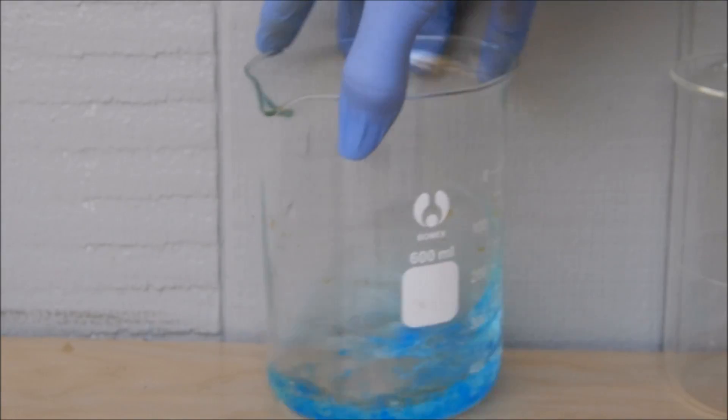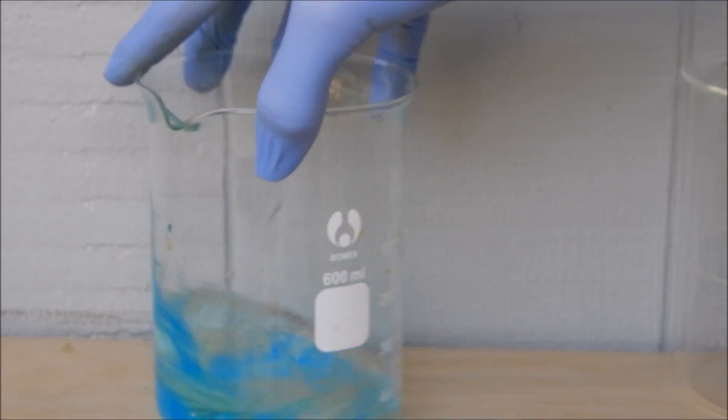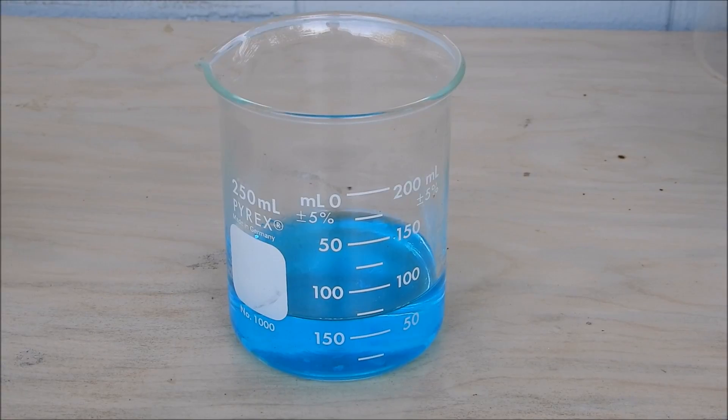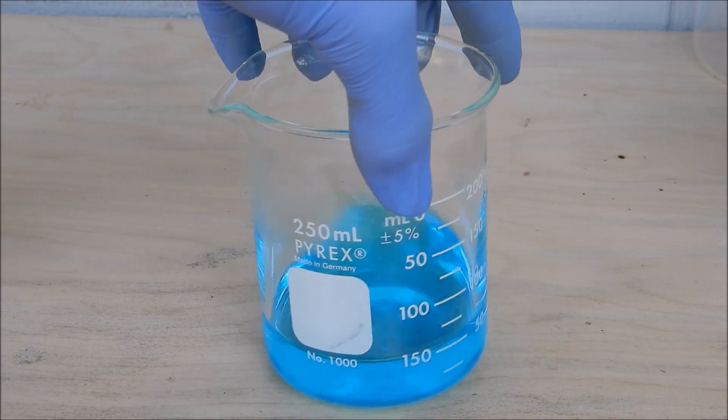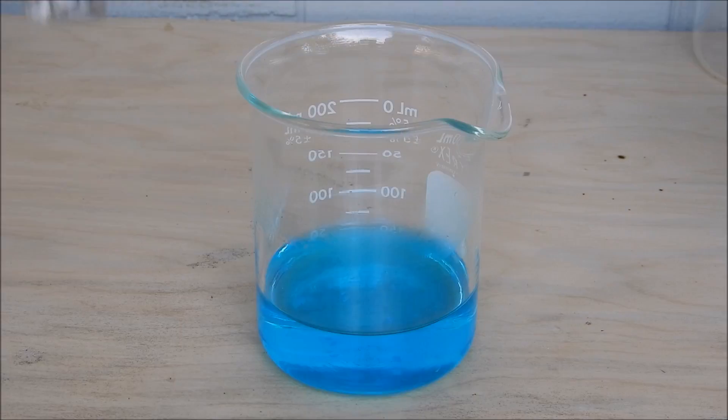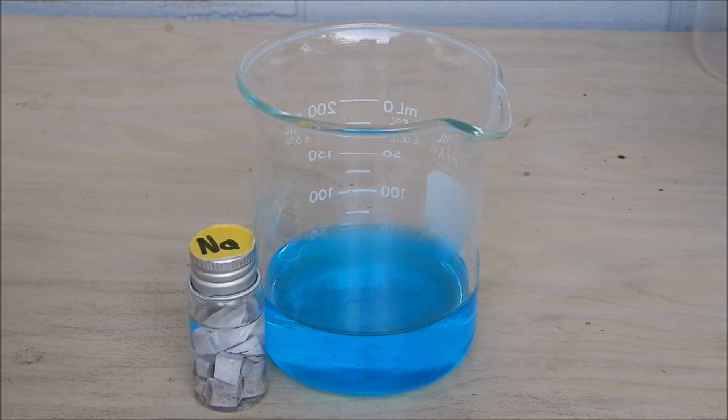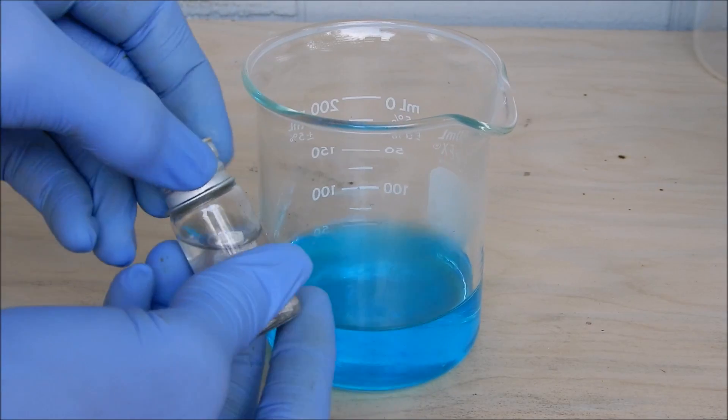Alright, so I transferred it to a smaller beaker because I figured the reaction would look better. So yeah, let's add the sodium metal. Okay, so while I take a piece of sodium out, let's explain why this reaction happens.